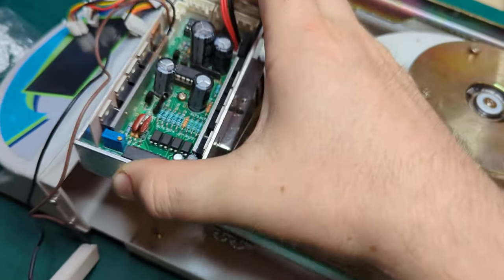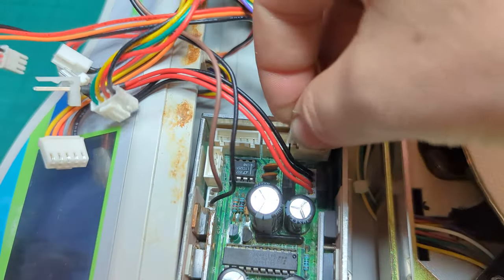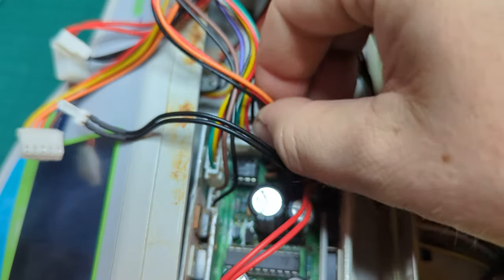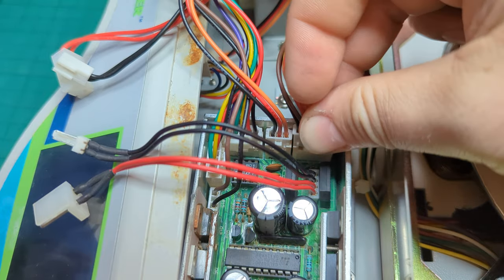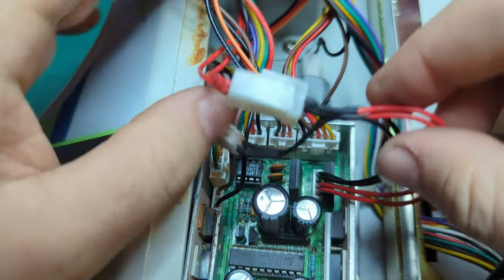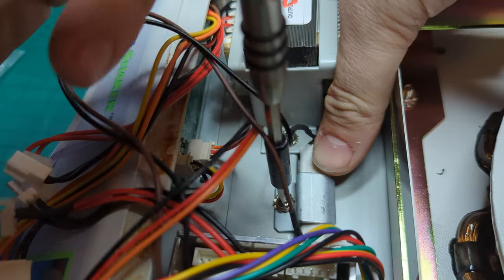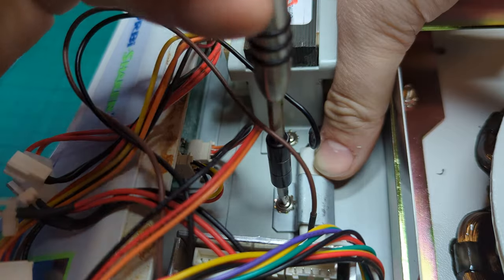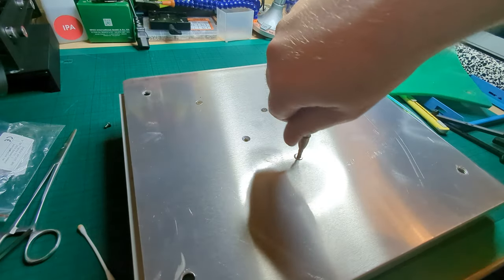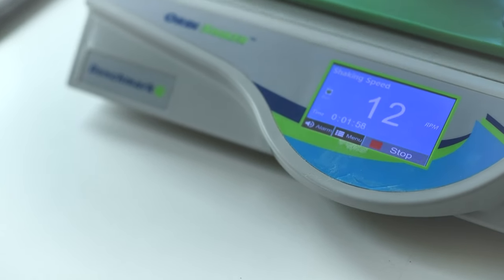Back to a discount build montage. We're actually using the clips in the right order this time, putting the clippy things in the wrong one and finding the right one. Eventually, for some reason, it got dark. And then we clip in the rest of them. Luckily, they're all different, so it's not that hard. Final clippy bit and shove the wires in, because that will just do. I can't be bothered to find a cable tie. Unnecessary shot of screwing what I think is a power resistor into the base. And then let's pretend that this wasn't just unnecessarily filmed. You've seen those clips before. And beauty shots.